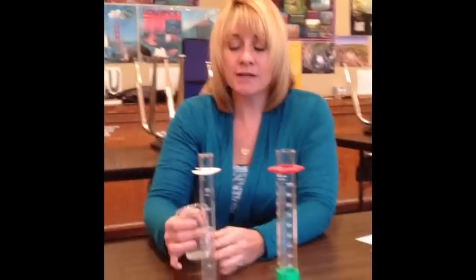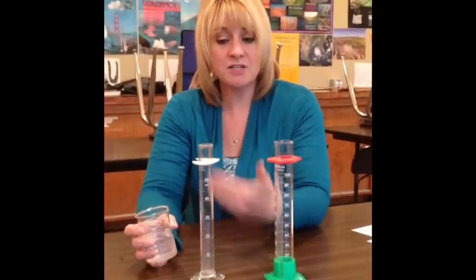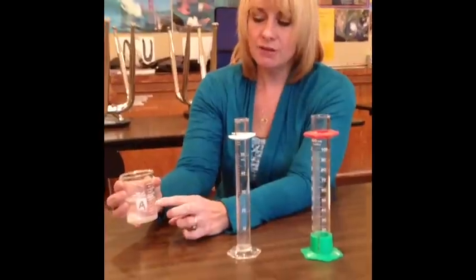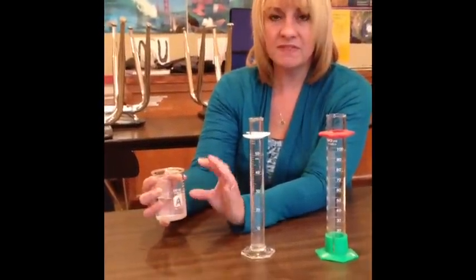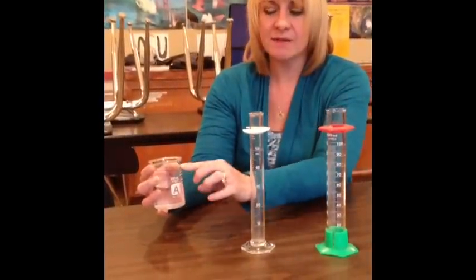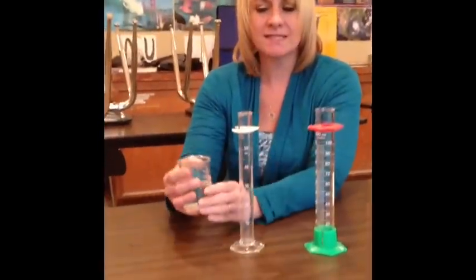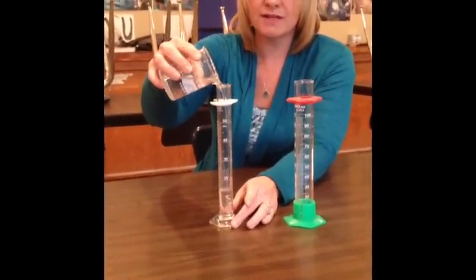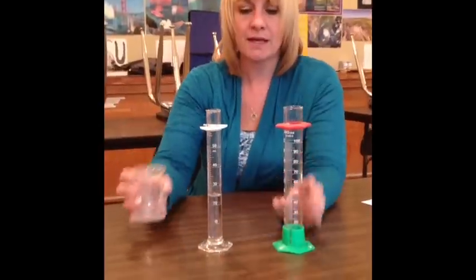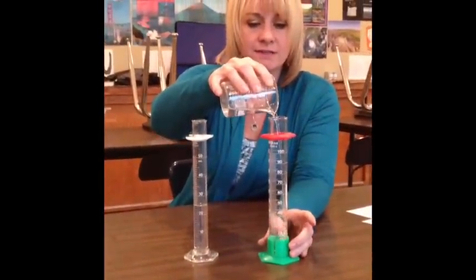Okay. So we're going to measure the volume of a liquid. See how much space this liquid takes up. You can see that in here, it's a little bit above the 80. But these are estimations on this, and we want exact amounts. So we're going to pour some water into this graduated cylinder. And we'll pour some water into this graduated cylinder.